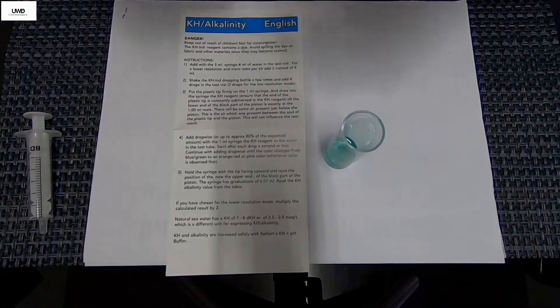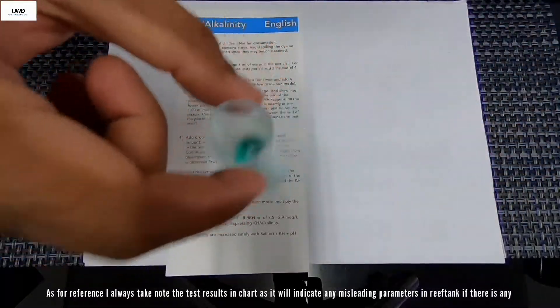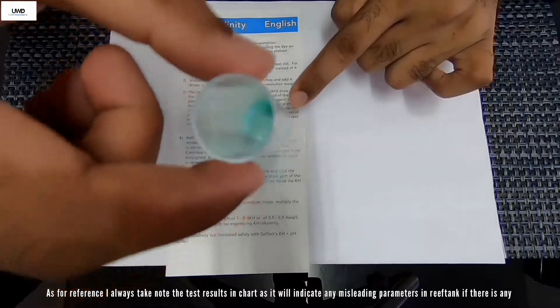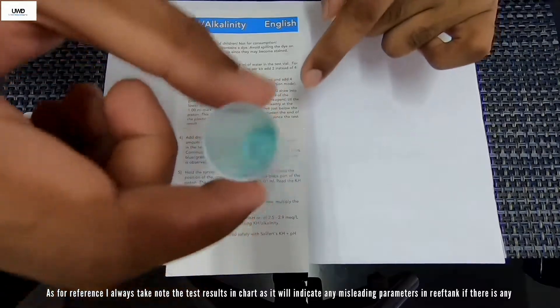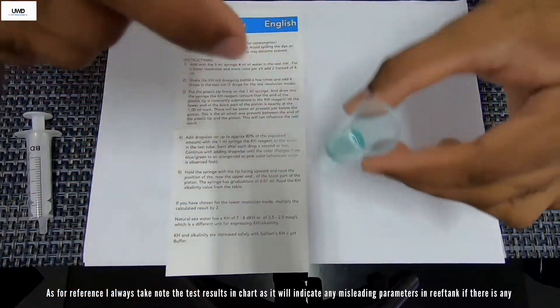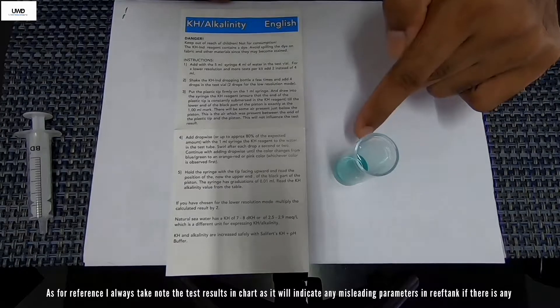Now what we're going to do is I'm just going to give a small shake or swirl like this. According to the pamphlet, always read your manual and pamphlet here, it shows exactly how to use. And you'll see it's going to have a turquoise or light green color here.